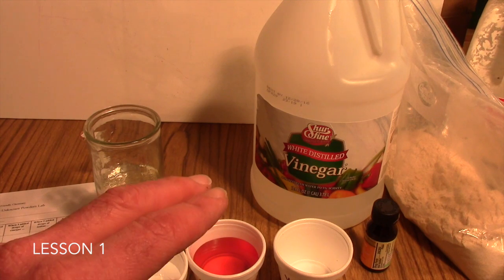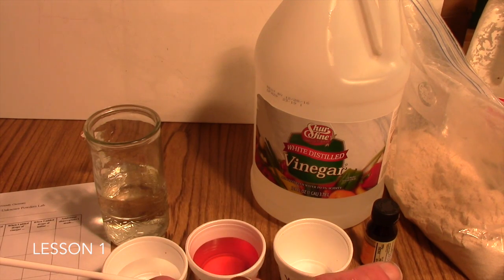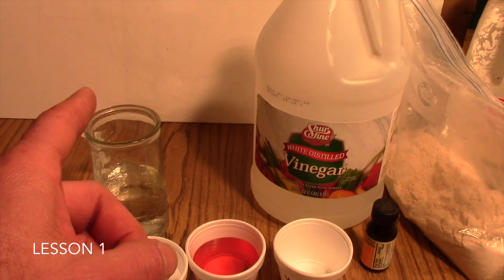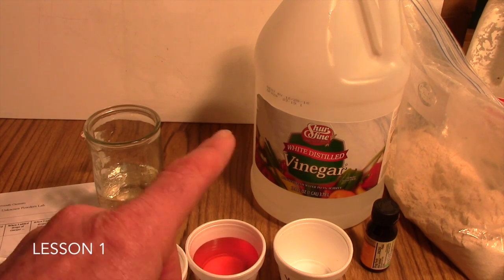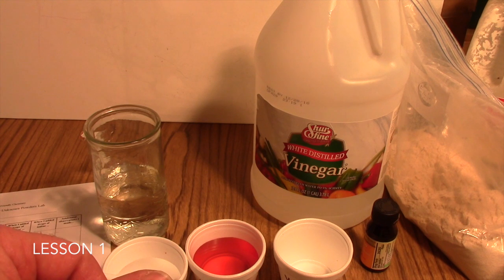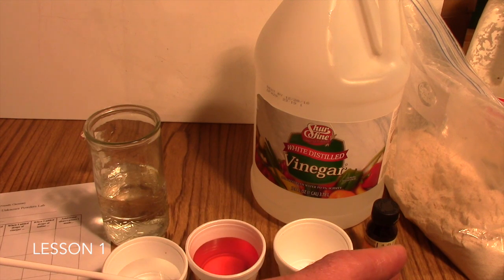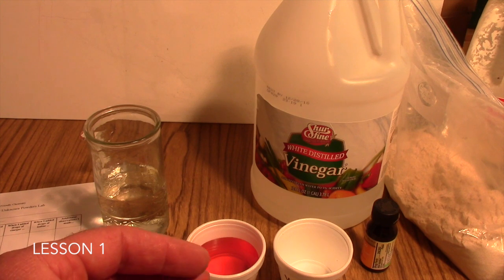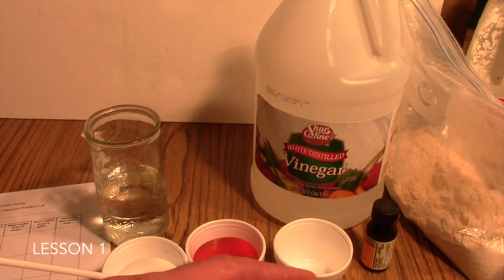And then when you look at other powders that look similar, how did you know that one was powdered sugar and one was flour? They both kind of look the same when you start out, just from your visual observations there. And so work hard with your students to have them explicitly tell you what were the observations that absolutely define for them the identity of that powder.